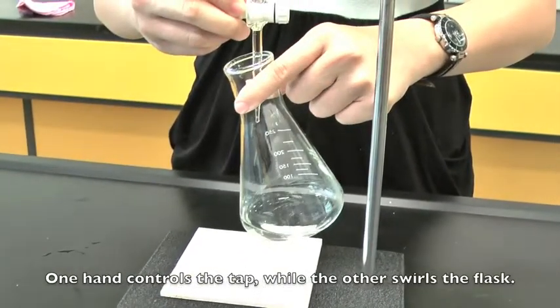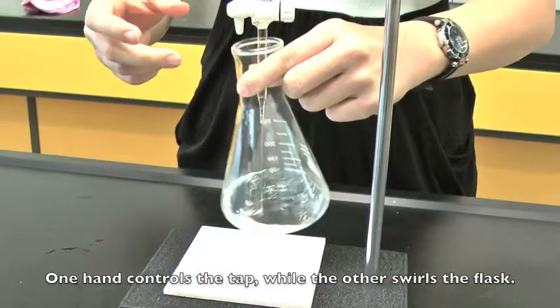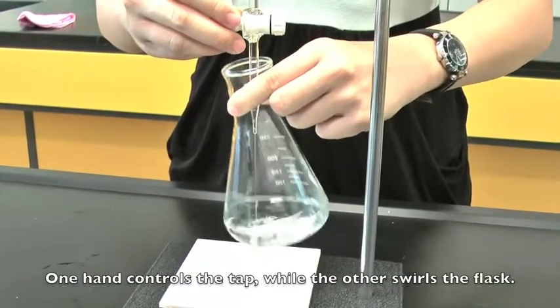Coordinate your hands in the manner whereby one hand controls the tap while the other's focus is on swirling.